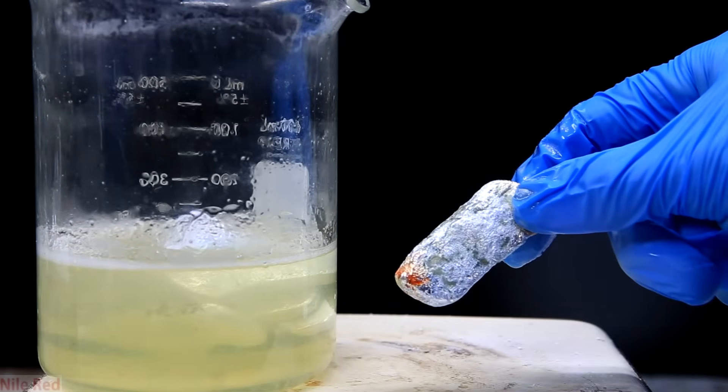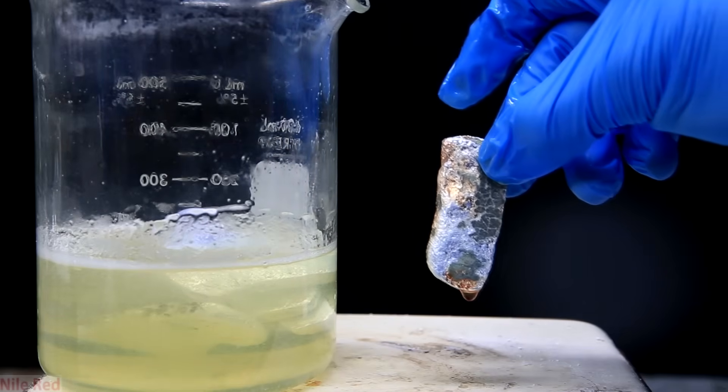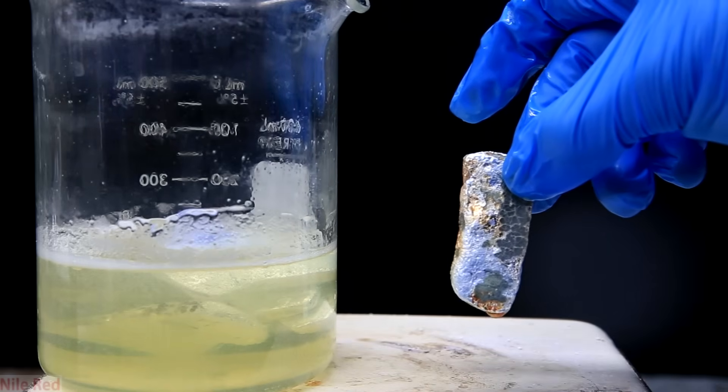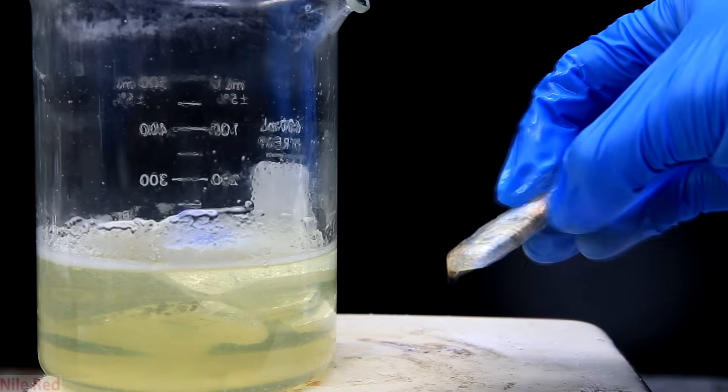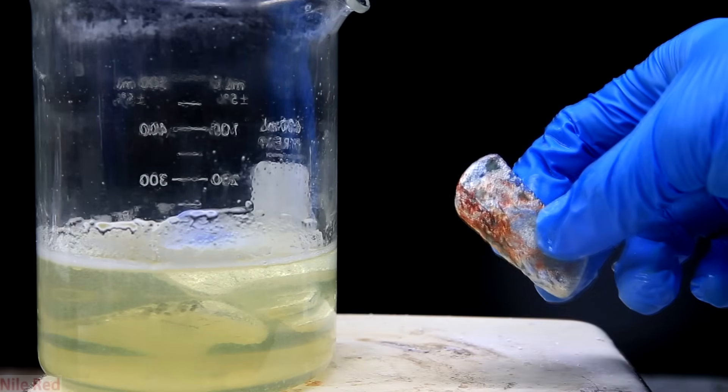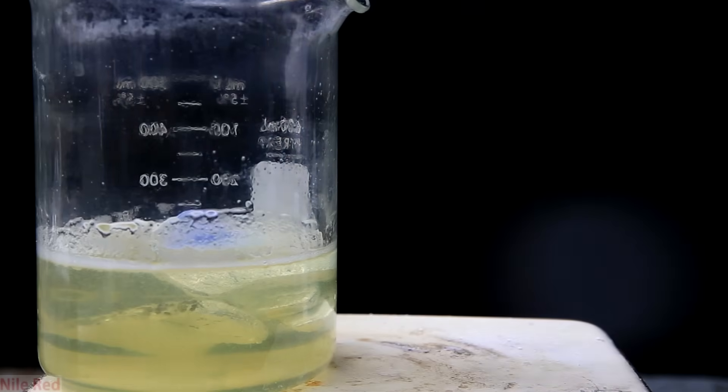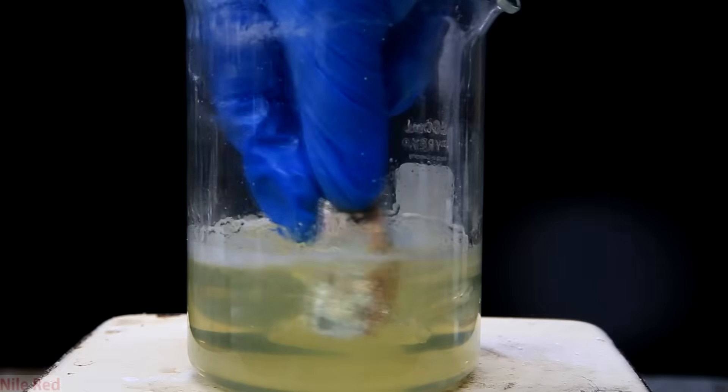I received it in a bag that was vacuum packed, but obviously there's still going to be some air that gets into there. It was perfectly shiny when I got it, but after a few months of neglect it was coated with yellow. All of the oxides have the same yellow color, so it's really hard to tell them apart and I don't really know if it's the peroxide, the superoxide or just the oxide.